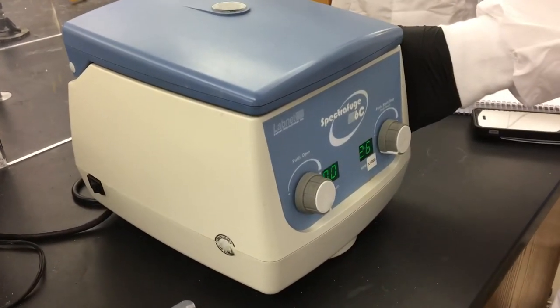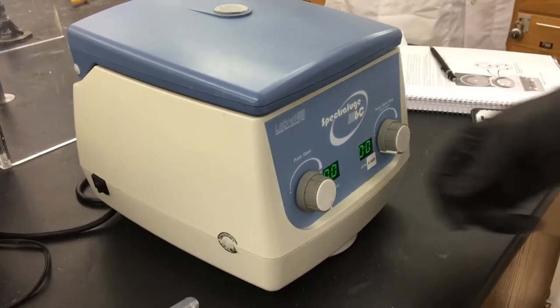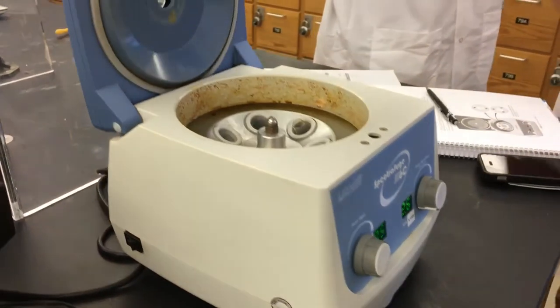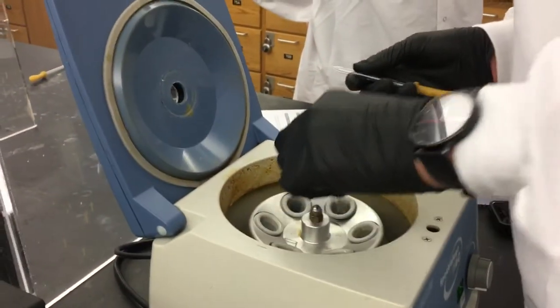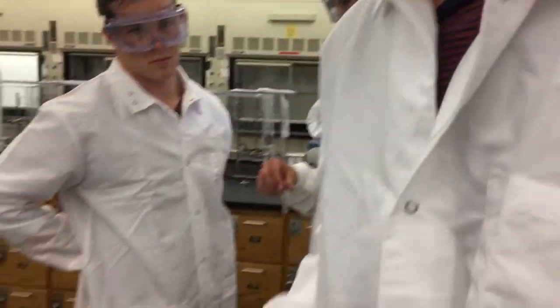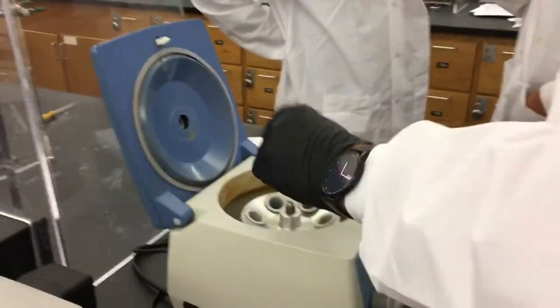There you go. Open it. And there you have it. Okay, alright, that's good.